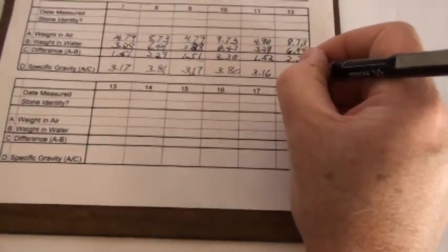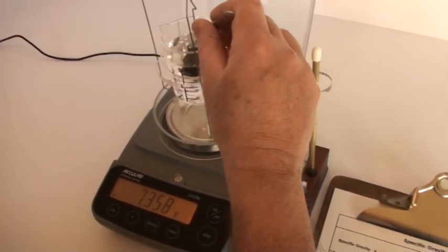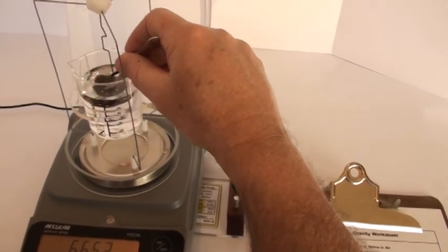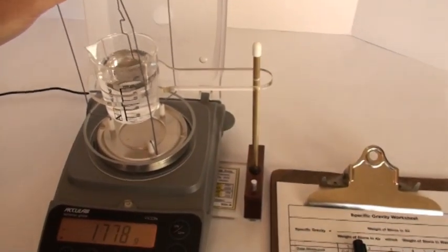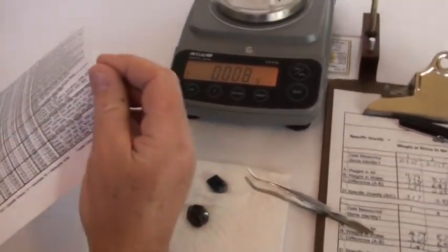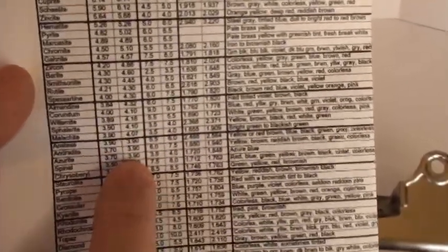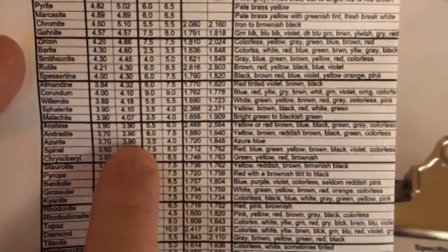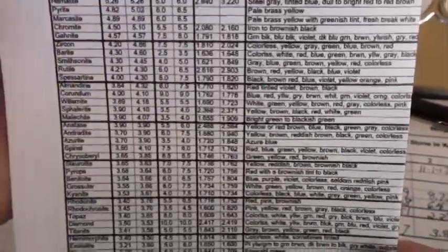Now that's a pretty high SG for a gem mineral of vitreous luster as this one is, which makes me think this might be in the range of zircon or garnet or corundum. See how versatile that is? So let's bring out our table. Again starting at the top with gold, all the way down. Look at that. There's andradite, which is what this mineral is, and that's a species of garnet. The textbook value is 3.70 to 3.90, and our measurement of 3.80 is exactly in the center. And I should mention too, you can see that this table has at least a half a dozen other properties of the gems and minerals to assist you in secondary testing.